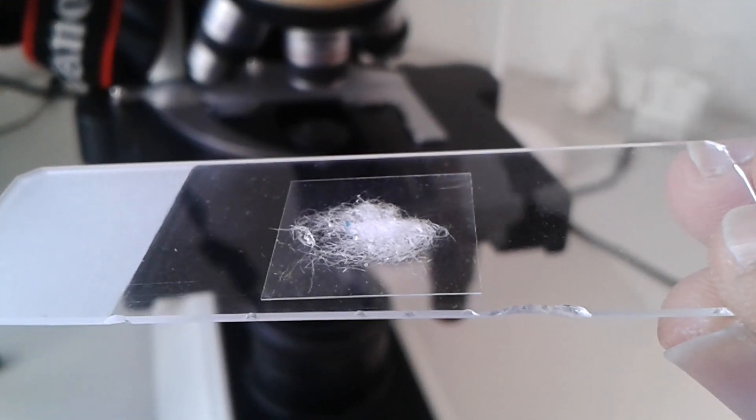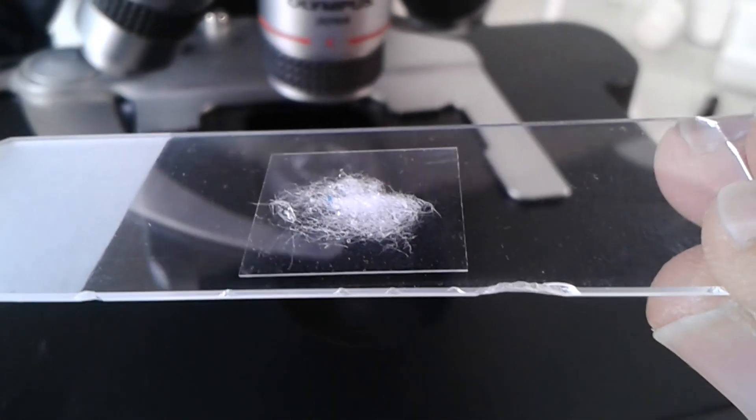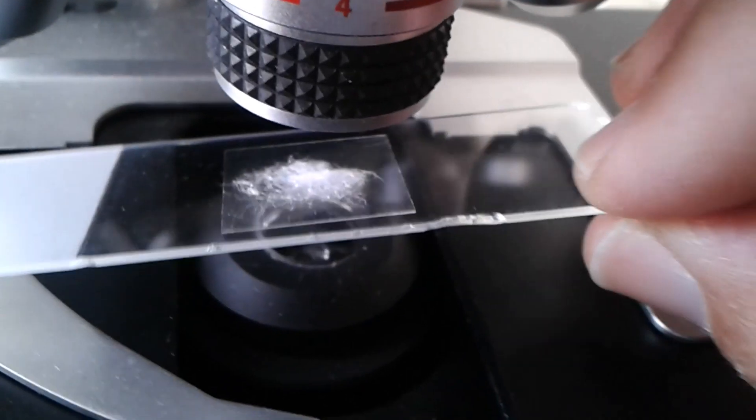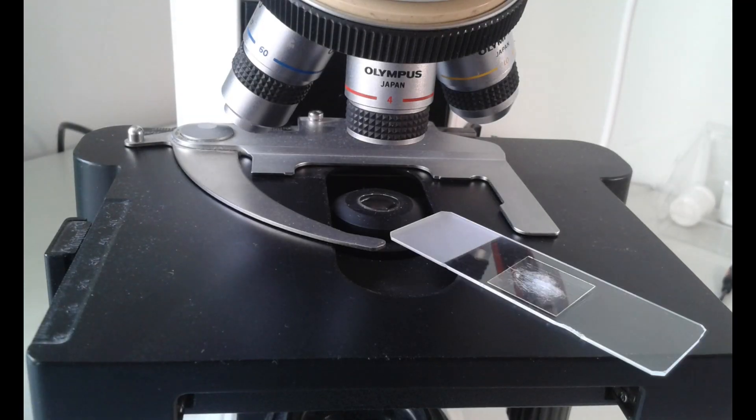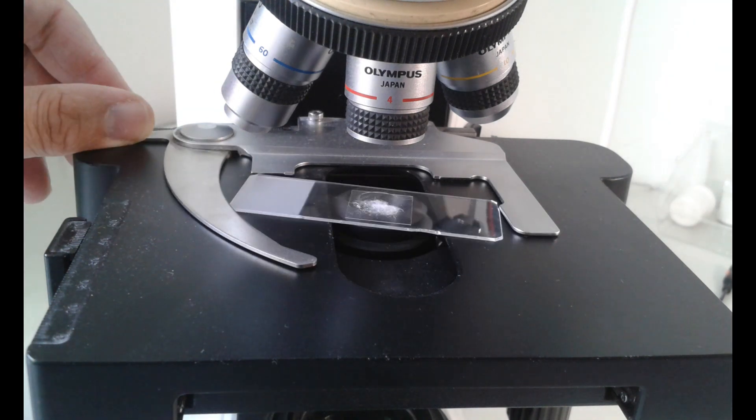Then I put everything under the microscope. You can allow the slide to slide in on its own, that's much easier.